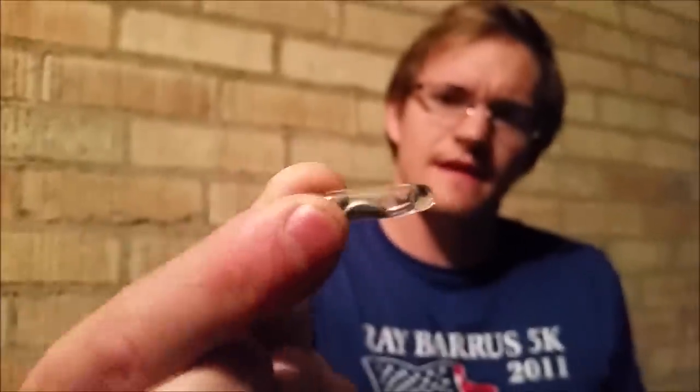I've taken one of my mercury necklaces and I'm going to do something many people would find very crazy. I'm going to drop it from eye height onto concrete — this should break it. It is tough glass but this is quite the fall. Go ahead and zoom in here and you can see there's a droplet of mercury and the broken glass.